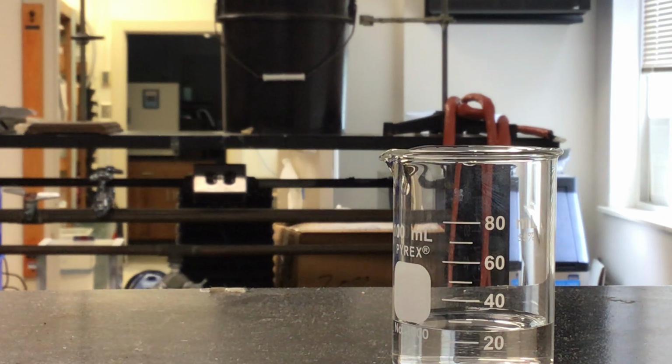So if I was going to read that volume, well, it's definitely between 20 and 30, but I can't say with any kind of definitive, oh yes, this is 25.00 milliliters for this volume. There's no way for me to get that kind of accuracy measuring with this beaker. It does look like it's maybe around 25 milliliters. It's definitely between 20 and 30, but we don't really have more significant digits to give other than maybe just the ones place in the milliliters. So if someone said 24 or 26 milliliters, that's probably fine here. But we don't have enough tick marks or calibrations on our measuring tool to be able to give more decimal places to the number that we measure.